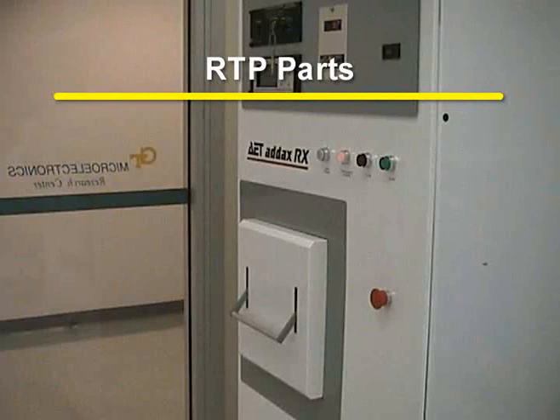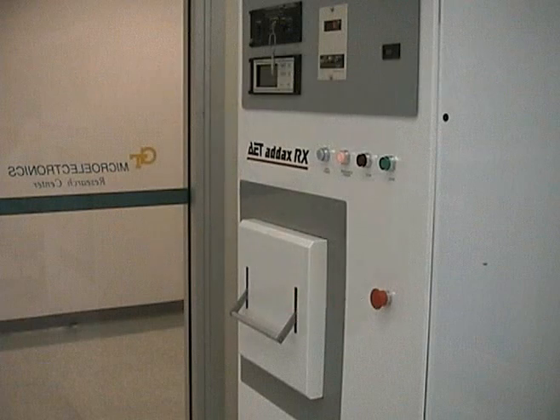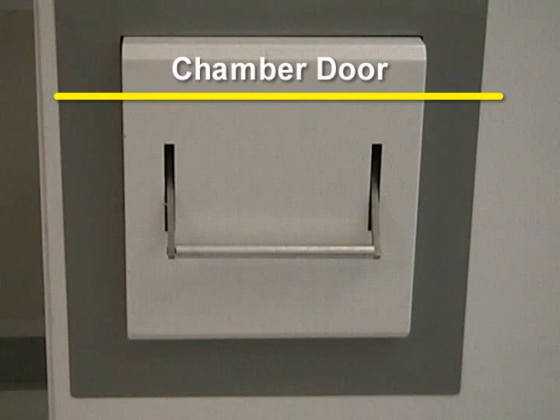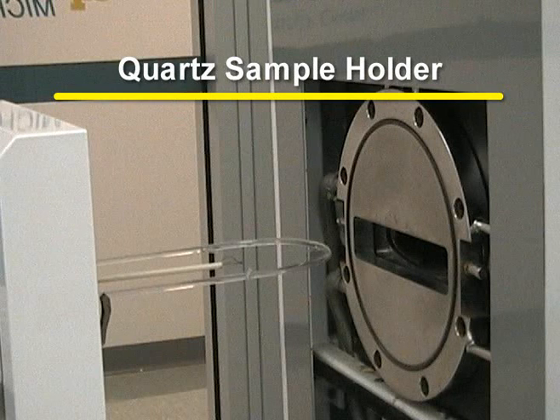Now we will go over the various parts of the AET RTP. Here we have the emergency off button. Please only press the emergency off button in the case of an emergency. The chamber door is located in the front of the machine. The sample holder is a quartz holder located on the chamber door.